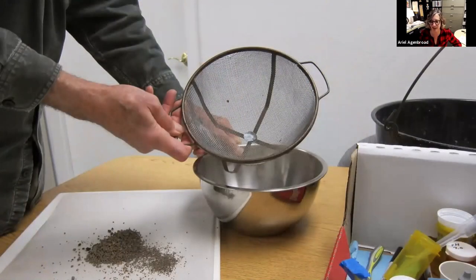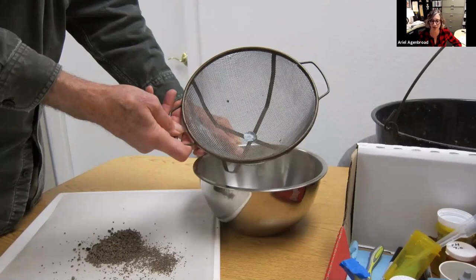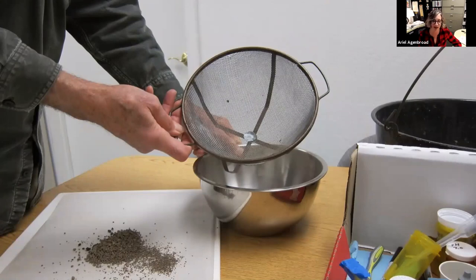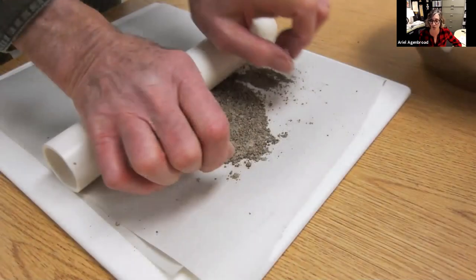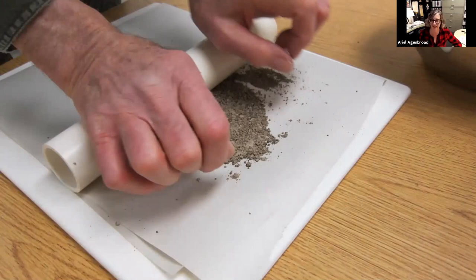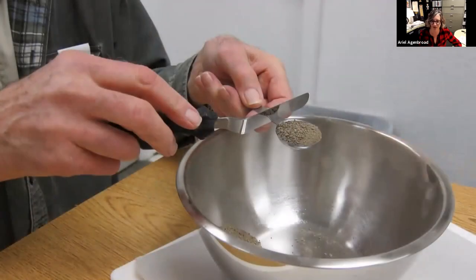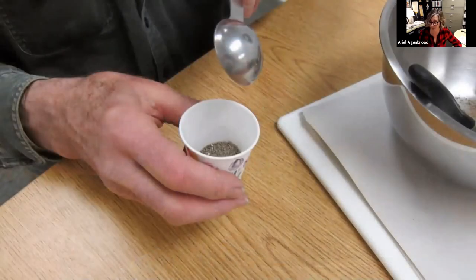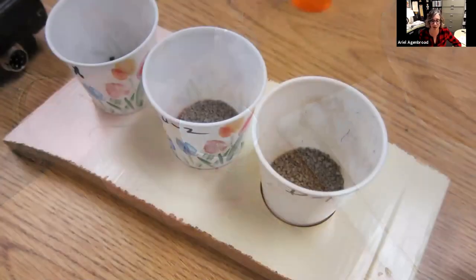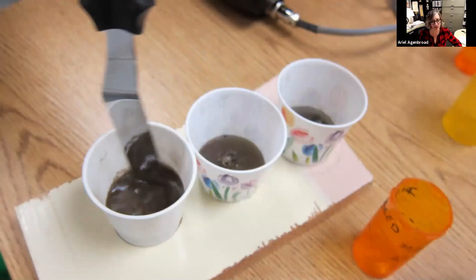David was really precise — he thought we should screen our sample. You don't have to screen your samples when you send them to the lab because they'll do that for you, but if you want to get an easier way to get your probe in there, you could screen your sample. David actually rolled it with a piece of PVC pipe on a cutting board to get it really fine. Again, you don't have to go to those extremes, but this encourages accuracy by preparing the sample this way. We had that one part soil to two parts water — he's got one tablespoon of soil to two tablespoons of water, using a Dixie cup.